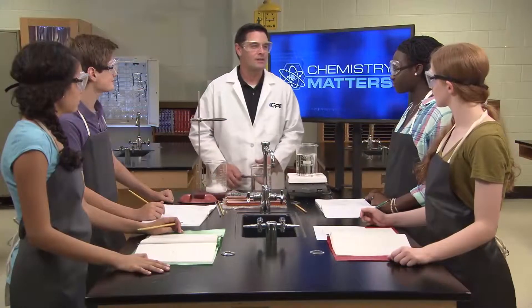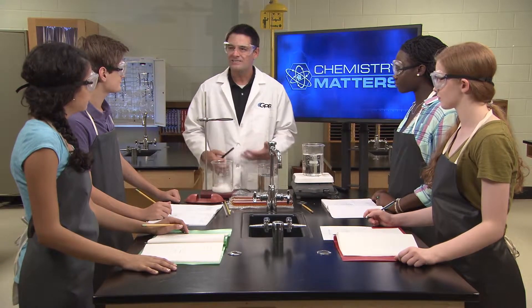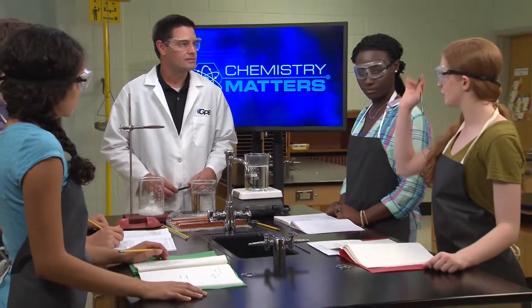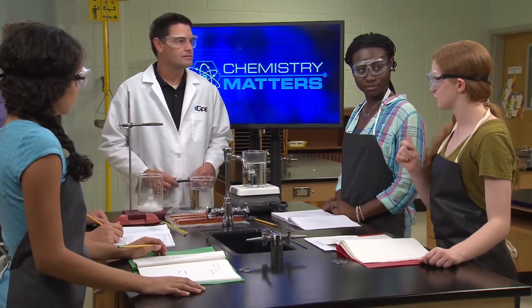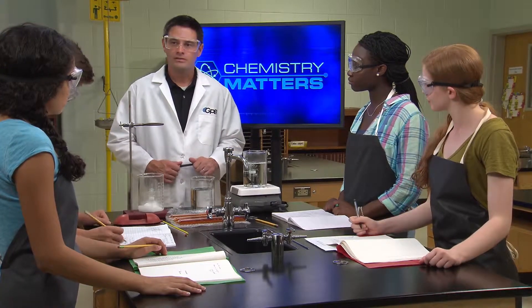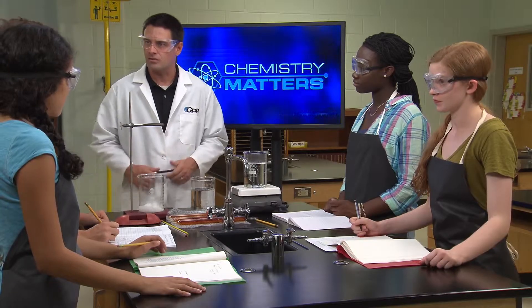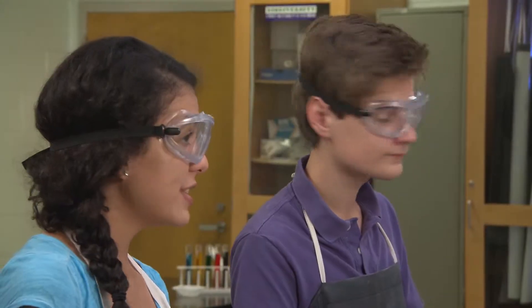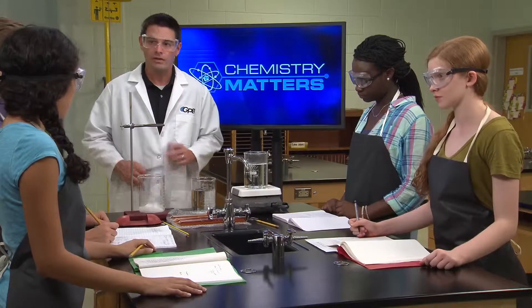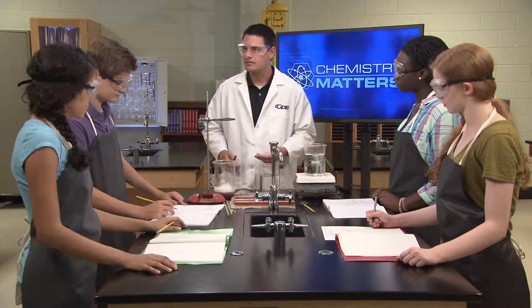Let's start by reminding ourselves what our experimental question is. What is the goal when we're conducting this experiment? We want to find out which gas is causing smog. That is what we're trying to do. How about your team? What did you guys state as your goal? We said our goal is to identify which gas is brown. It sounds like our goals are consistent and clear.